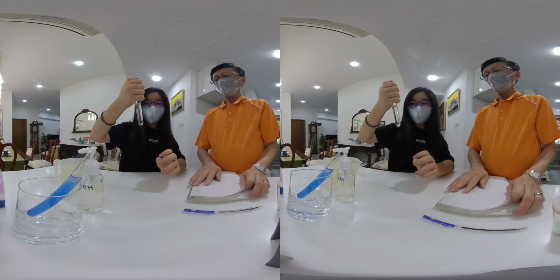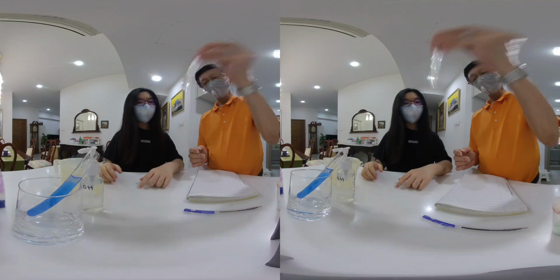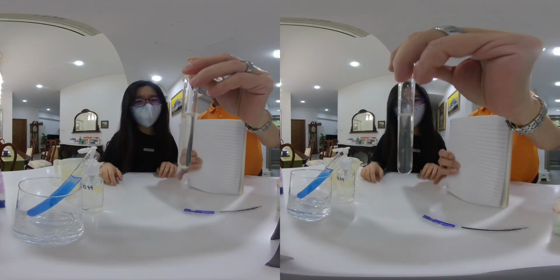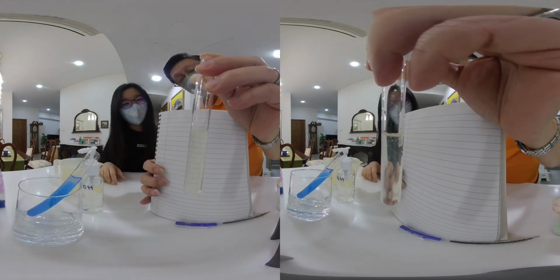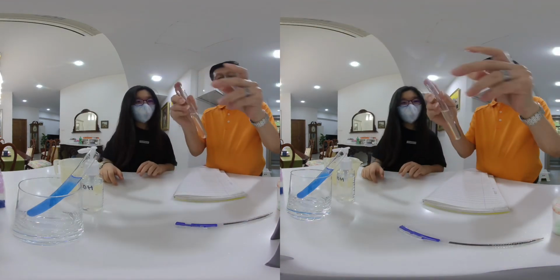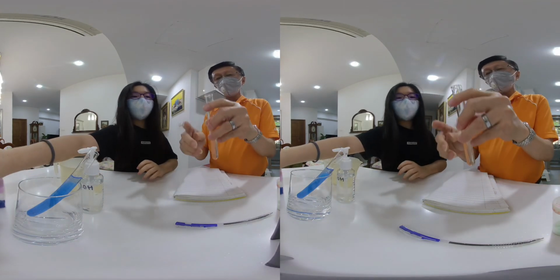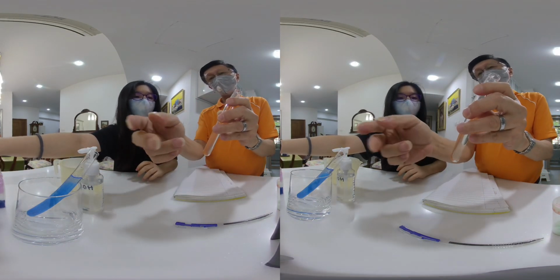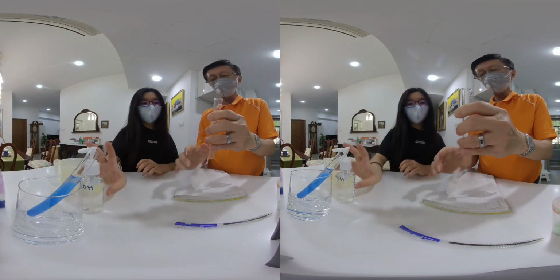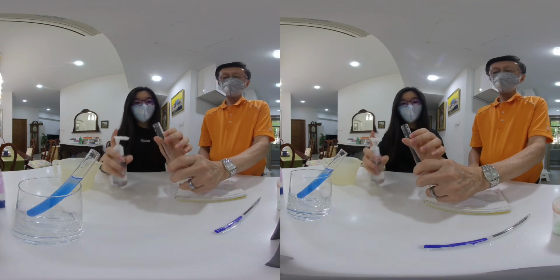And this time, this is a little bit, what color? Green, huh? It's a little bit greenish, right? Very light green. Now there's only very little amount of iron 2 sulfate, okay? Now I'm going to add excess sodium hydroxide. See what you get.